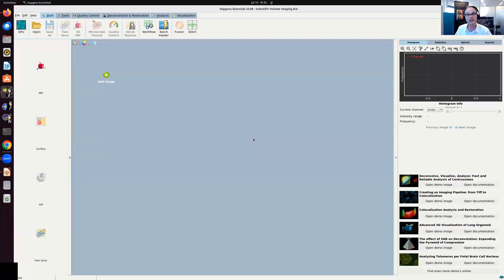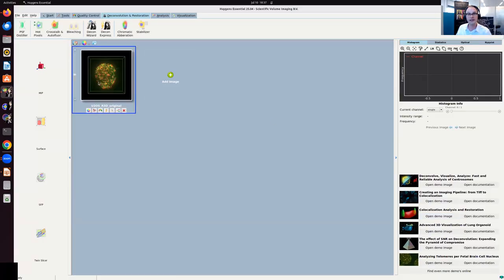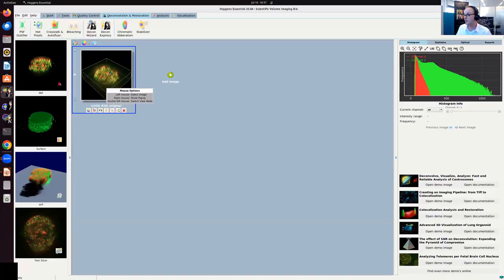Okay, so I just opened the Huygens Essential for the demonstration that I'll be showing you today. The Huygens Essential recently got an update in terms of the user interface. You can see now all the icons are collected in these menus, and I just got these nice icons that you can see here. What you also notice is that you have a few demonstrations ready to go here on the right. So today I'm going to use the colocalization demonstration. By just clicking this button, the data will load. Now, if you have a professional license, you also have access to this demonstration data. You just have to download it from our website. Happy to send you the link, and no problem.